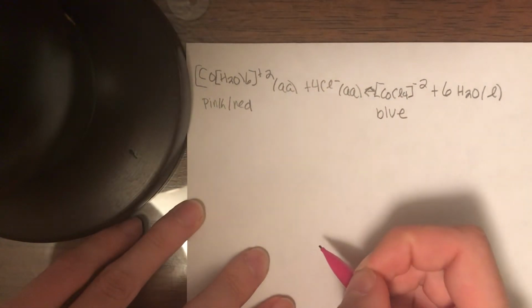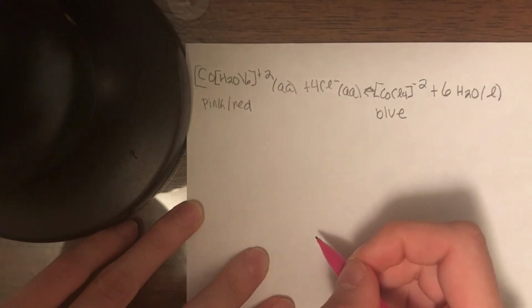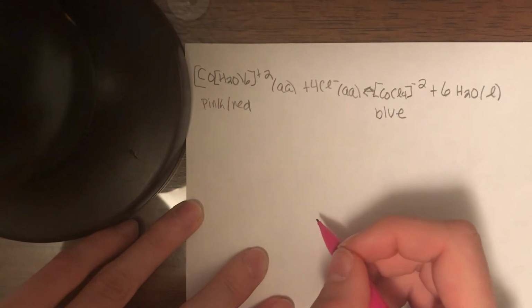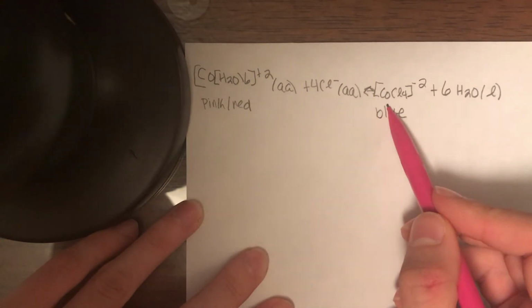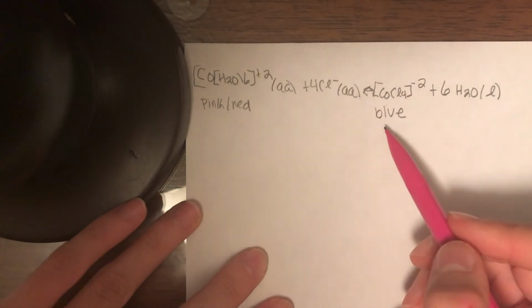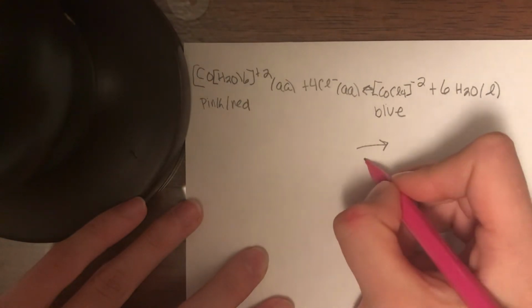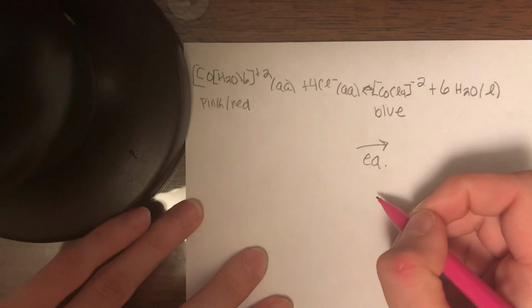The first stress applied to the solution was being placed in boiling water. When we did this experiment, the solution turned to a darker shade of blue. This means that there is a higher presence of CoCl4 2- ion in the solution because it was the color blue. The darker shade of the solution means that there was a shift to the product side, which is a shift to the right in equilibrium.